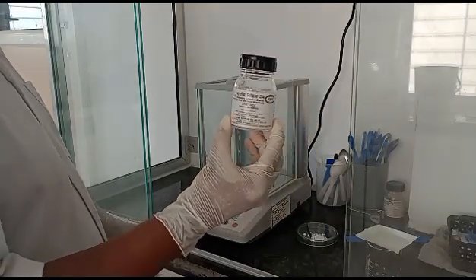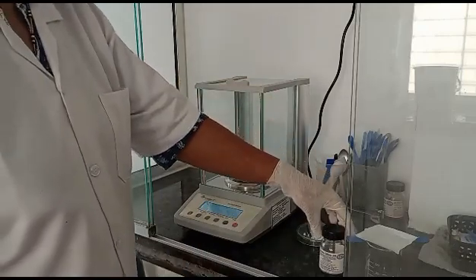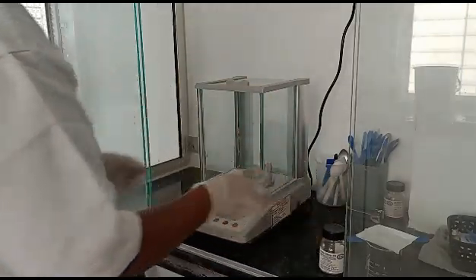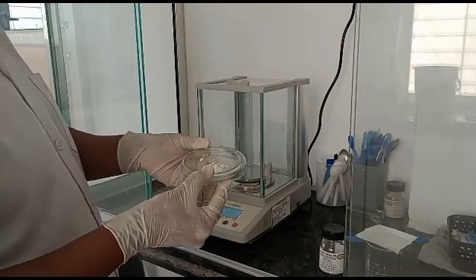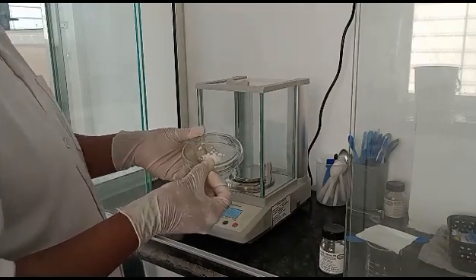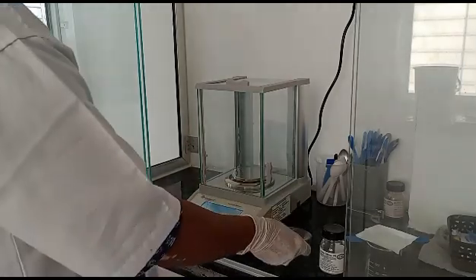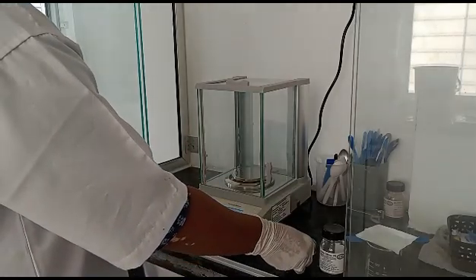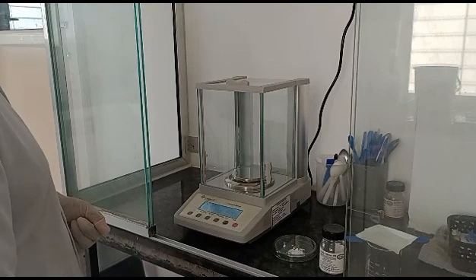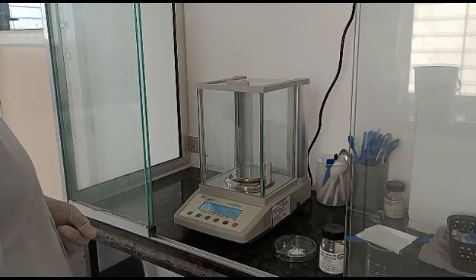From this, we will take approximately some quantity in an evaporative dish or Petri plate and we will pre-dry it. Here we have pre-dried it for half an hour in an oven at 105 degrees Celsius.